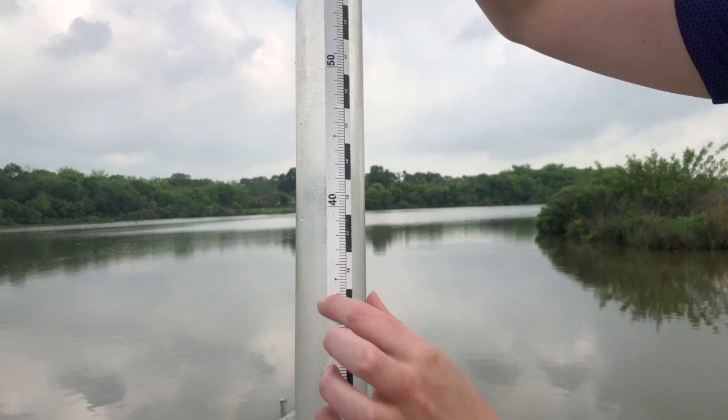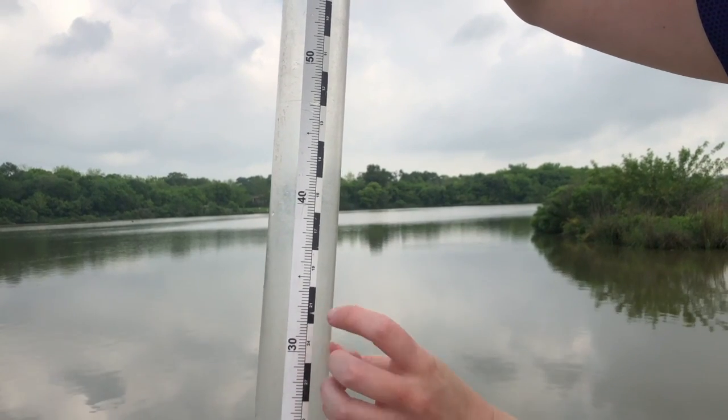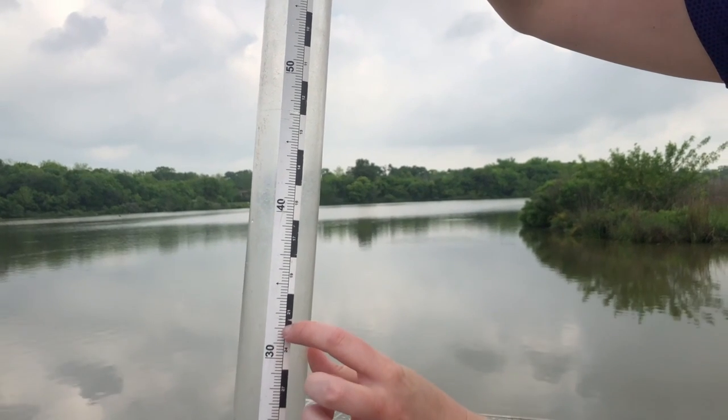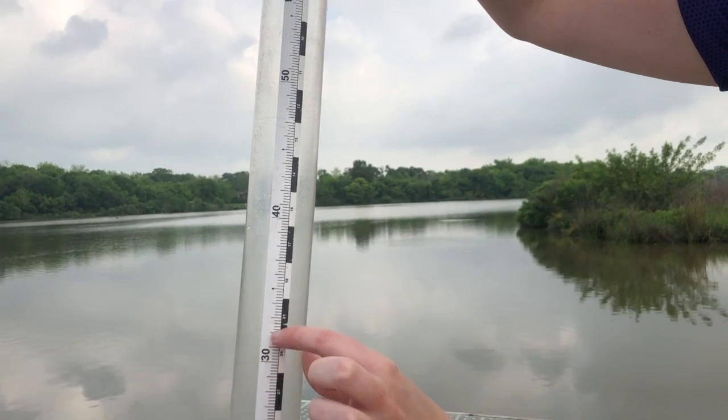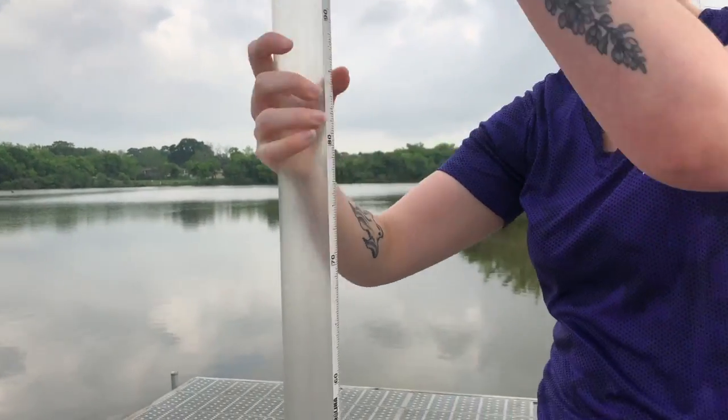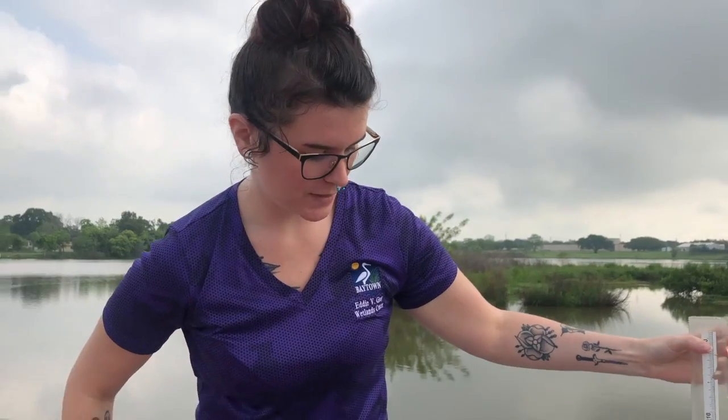So the way we do this one is we're just going to count, right? So we have 30, 35. If we want to do 32, we would count 31, 32, and then 33, 34, 35, and then it would go up to 40, as it should. So we're going to see how we measure with this one.